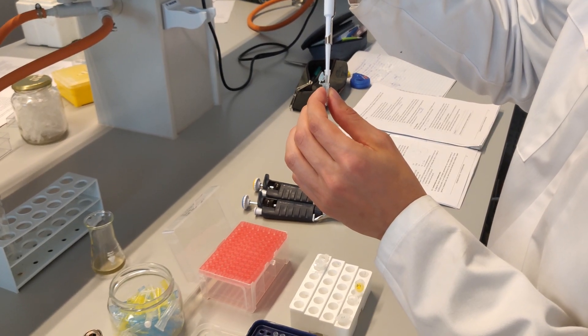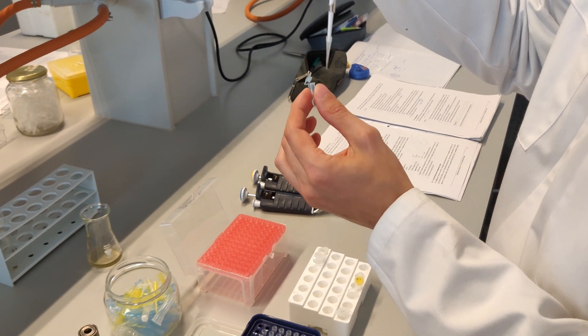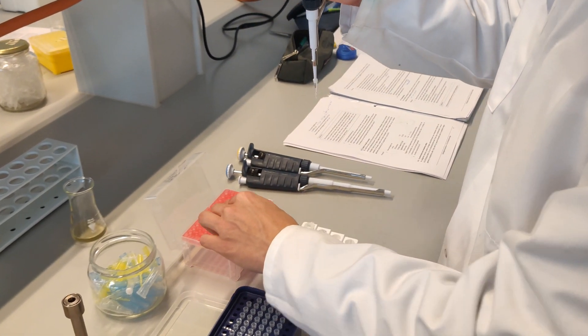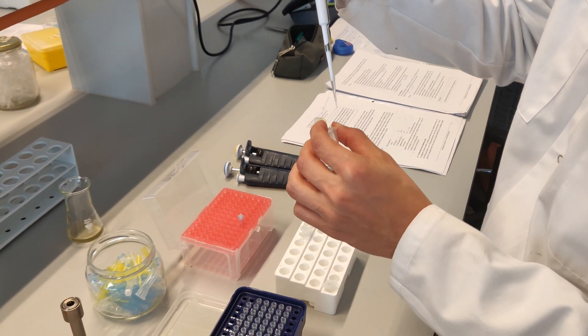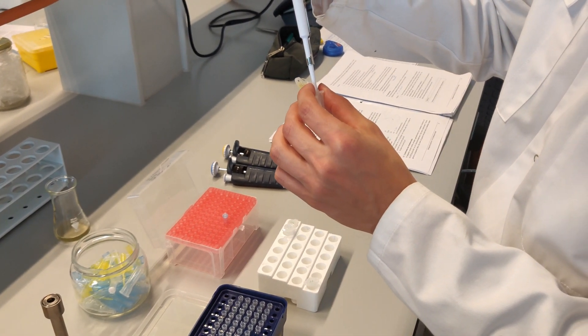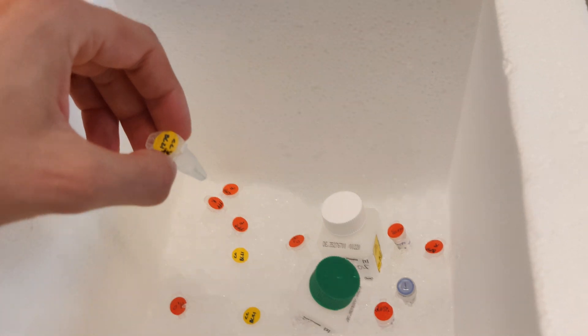In this procedure add 4 microliters of the plasmids to the bacterial culture and mix gently. Incubate on ice for 30 minutes.